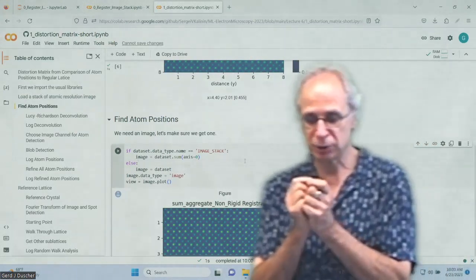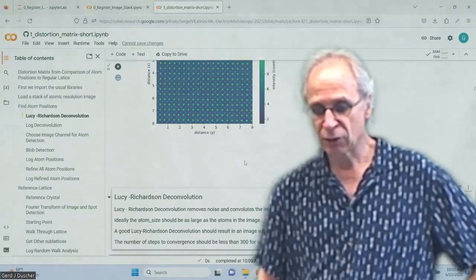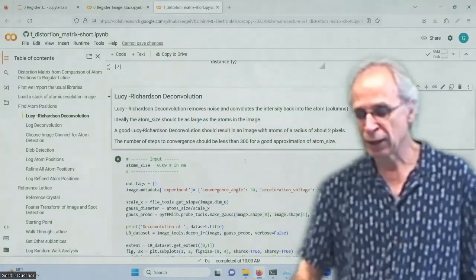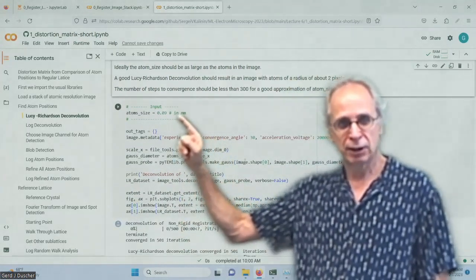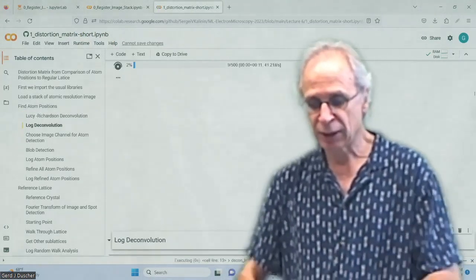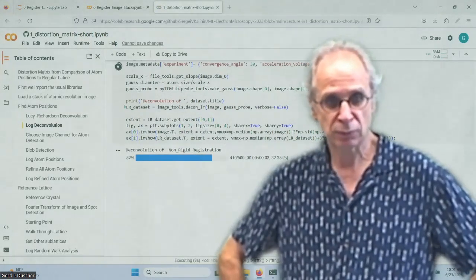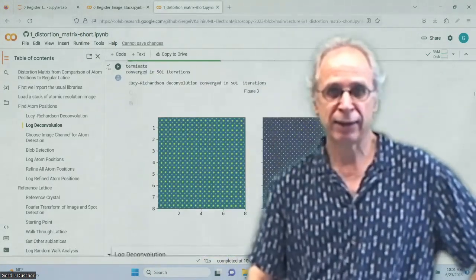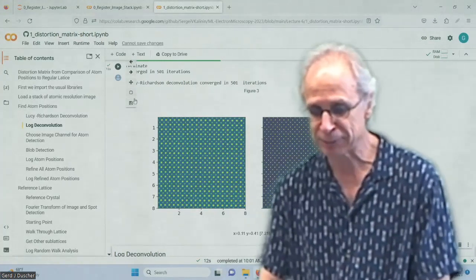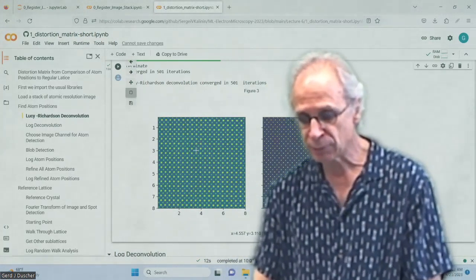we have to find now the atom positions. And even though this is a good image, it's not going to be good enough. So first of all, we sum it. Now we have an image. And what we do with this image, we do a Lucy-Richardson deconvolution. And for that, you have to input how big the atom is in that view. Okay. In our case, the atoms are about 90 picometers, and the Lucy-Richardson deconvolution is relatively fast. And you can argue it is. So Lucy-Richardson deconvolution is based on maximum entropy. Could be a machine learning, could be not. We don't care, right? We use it. And the effect, of course, is what we are after. If we zoom in here a little bit. No?